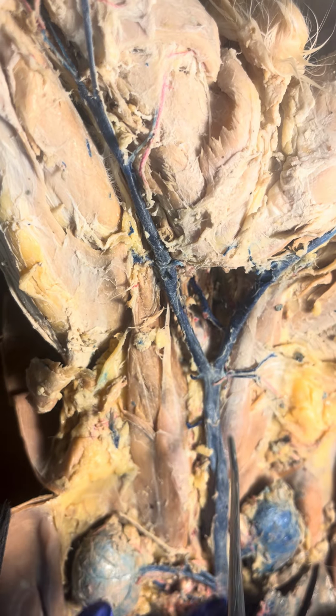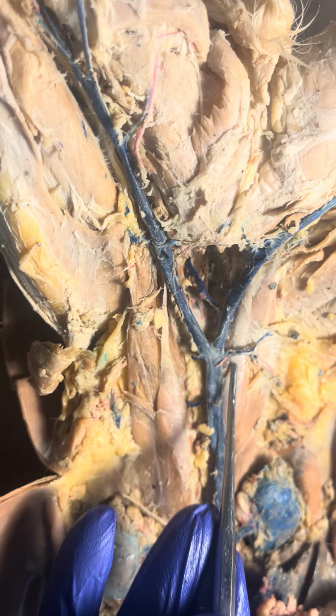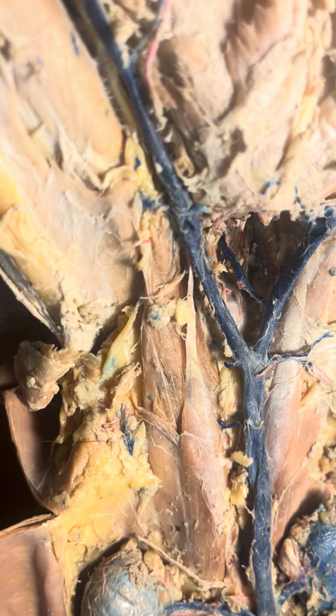And then it's called the common iliac, and then it joins with the other common iliac into the inferior vena cava, and then blood joins from the iliolumbars, from the gonadal, spermatic, or ovarian, from the renal veins and the adrenolumbars, and then from the hepatic vein. And then this inferior vena cava joins the right atrium. And those are the lower veins of the cat.